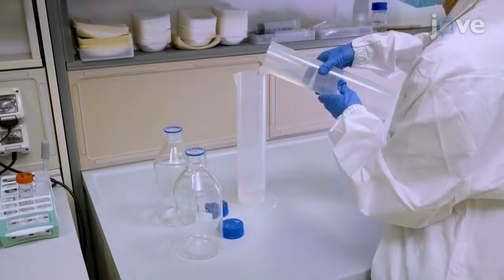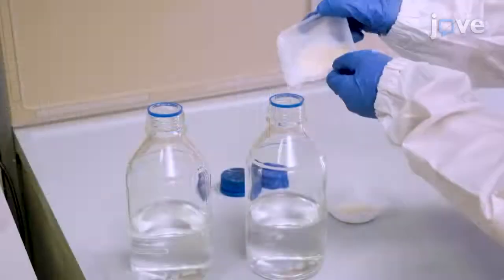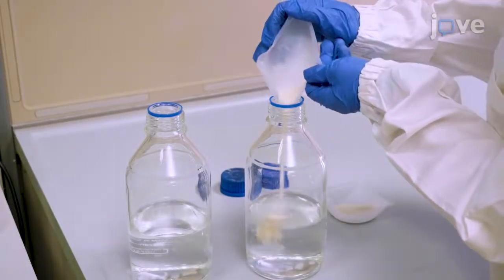Aliquot 500 ml of the medium into a 1 liter bottle and add 4 grams of agar to prepare a solid medium.